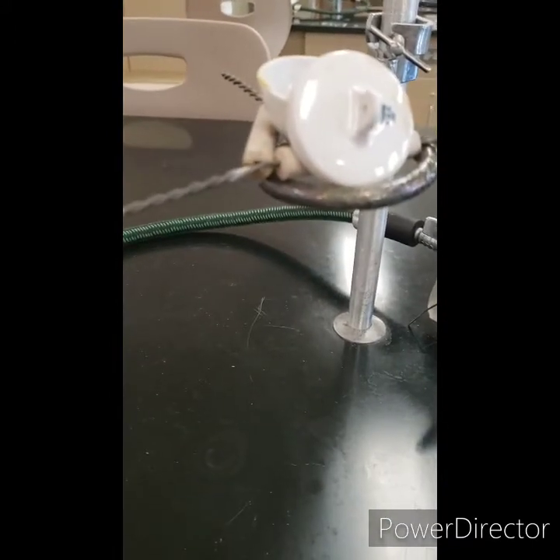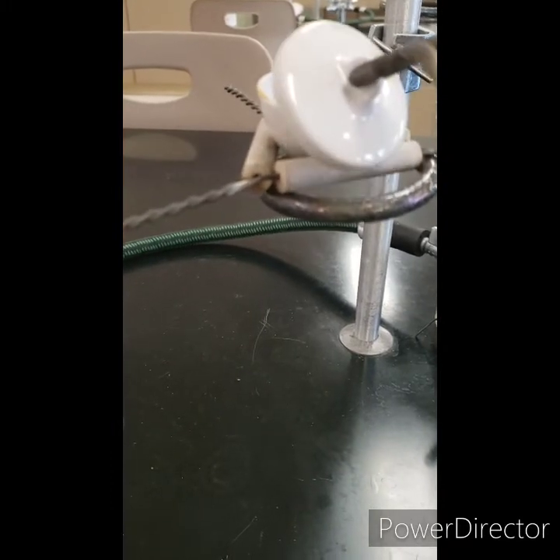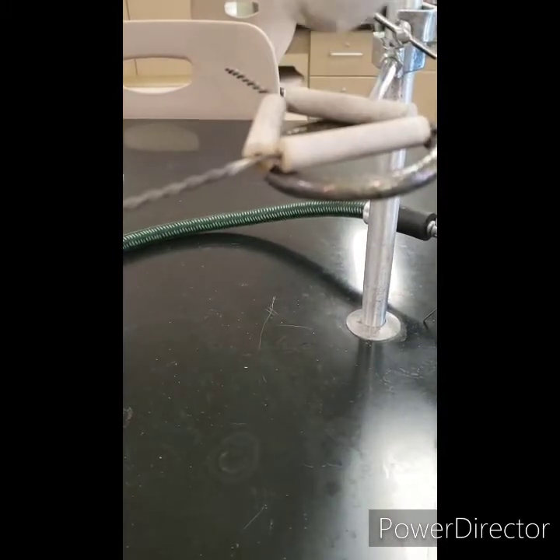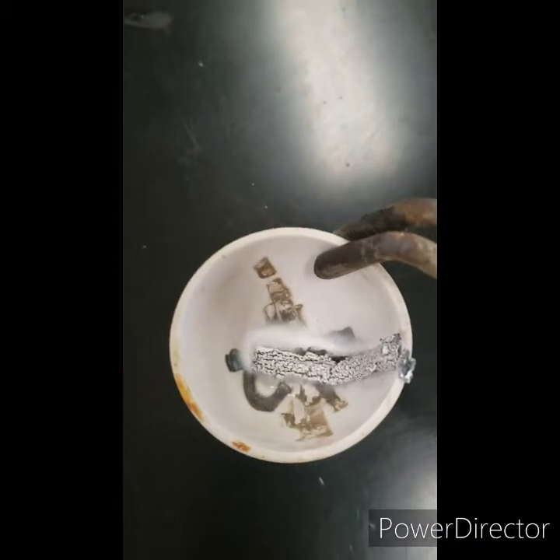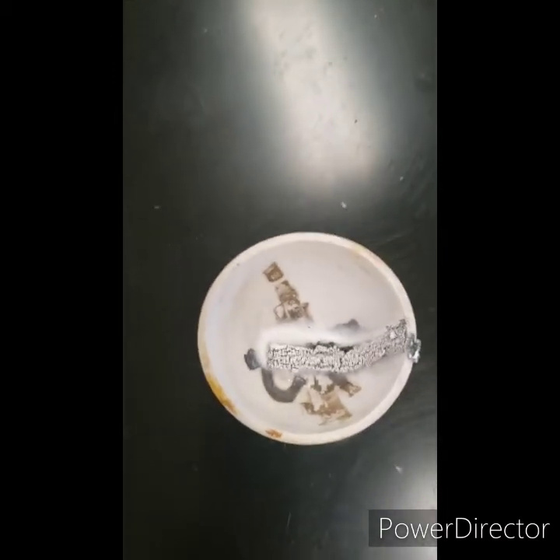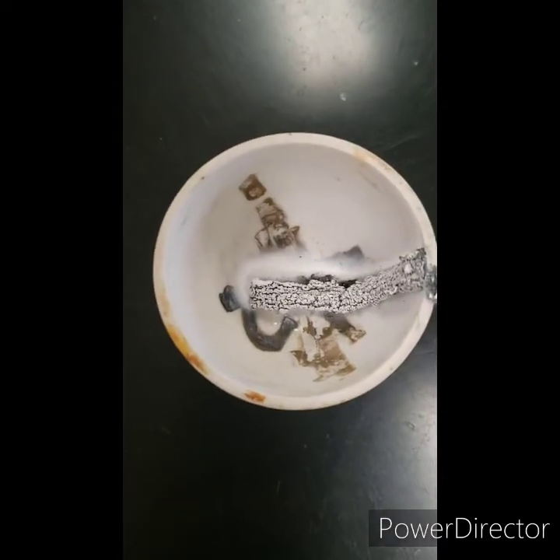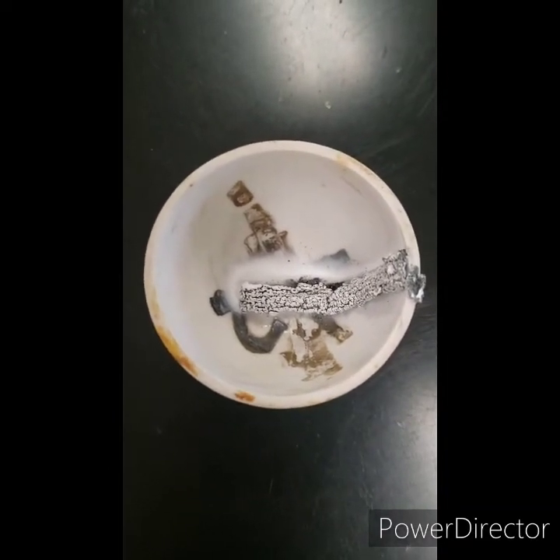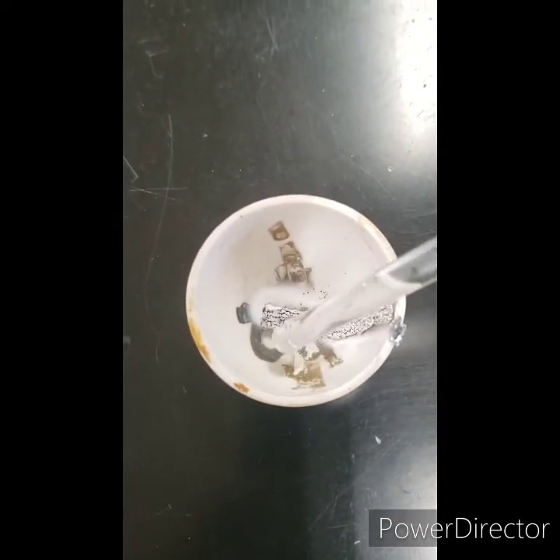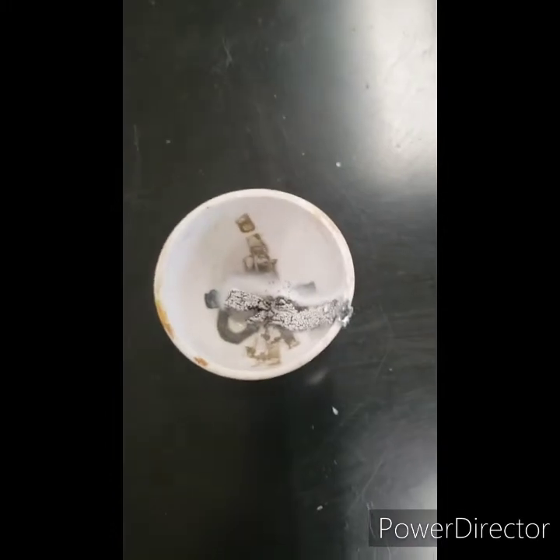Now let's see what's inside our crucible. We carefully remove the lid and take a look. Notice that the color is very different — your magnesium was silver and shiny, but now it's white. And it's brittle — we can prove it, look, it breaks right apart. And it's dull, it's no longer shiny. So this magnesium has transformed.